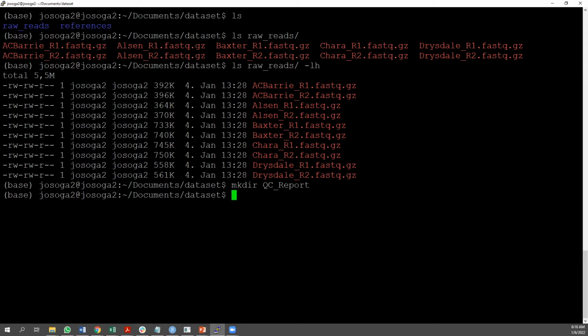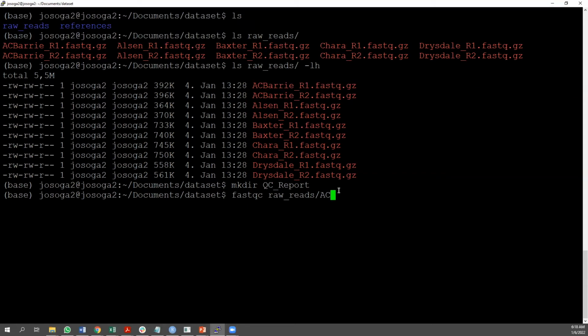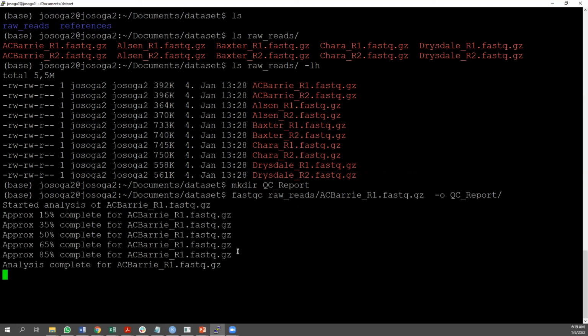Yep. So the next thing is to run your FastQC command. To do that, you say FastQC, for example, raw reads. I'm going to locate the file inside raw reads, ACBarrie, which is the first one. I'll be picking the first one for now. Sorry, yeah, R1. And to specify where the output will be located, you say flag small letter o QC reports. And it should be completed in 1, 2, 3, 4, 5 seconds.